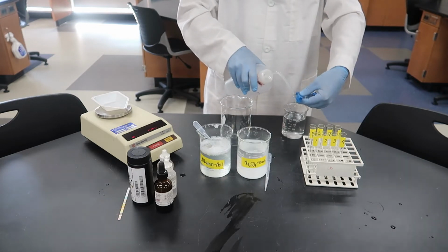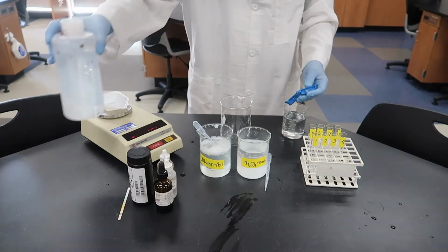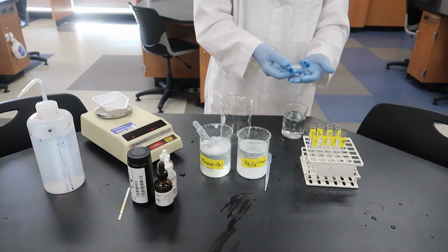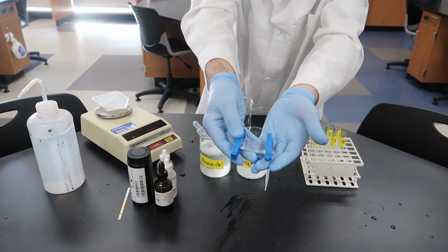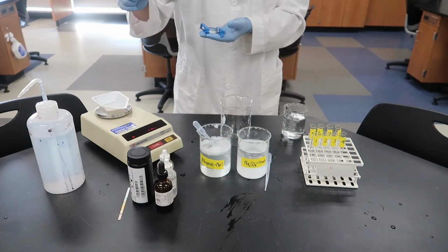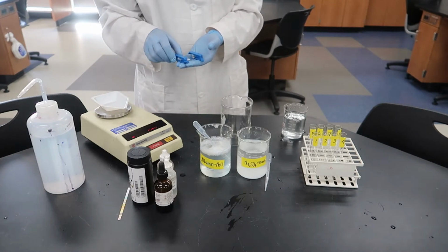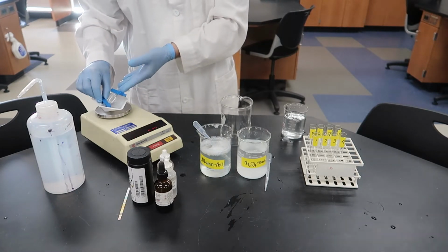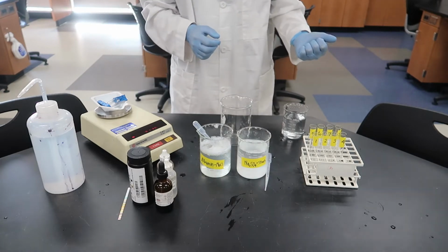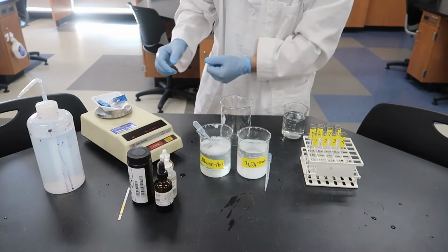Okay, if you remember, we needed to find out a way to tell if water will diffuse into or out of the bag during our experiment. And there's our bag, it's all ready to go. Now if we want to find out if water moves through the bag, we can just stick it on the scale and get its mass now, and then compare that to the mass at the end of the experiment. Okay, its original mass is 21.15 grams.